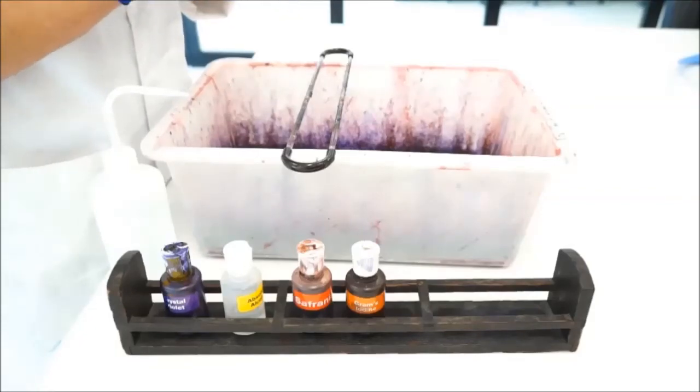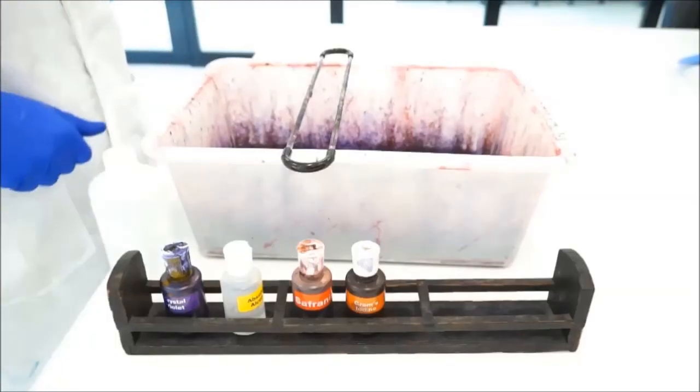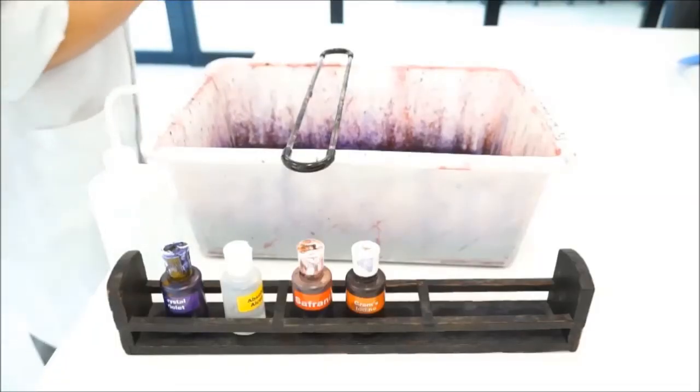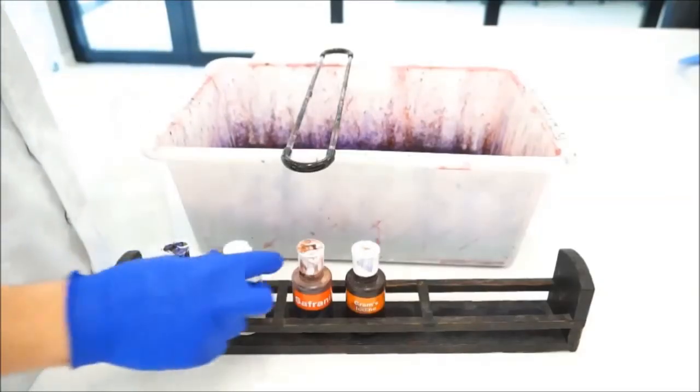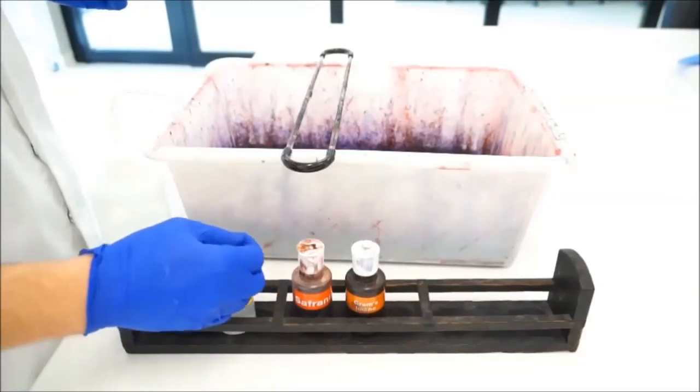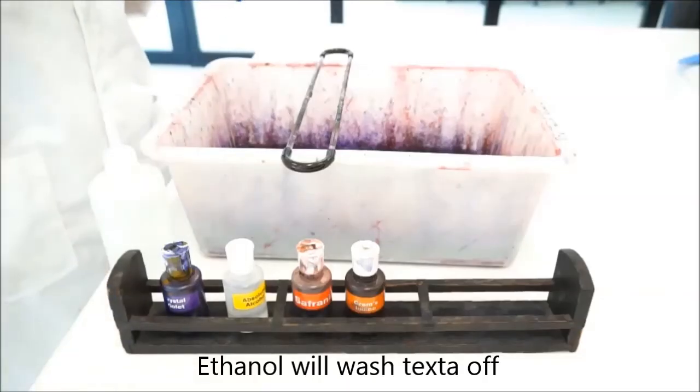And that's your Gram stain. Just remember, if you are marking these with markers to identify them, the ethanol will wash the marker off, so you'll need to identify them in a different way.